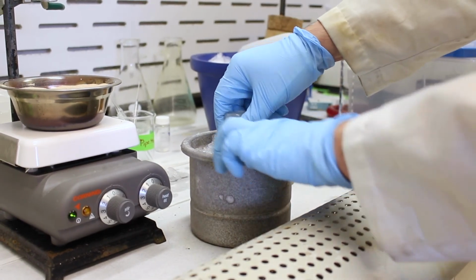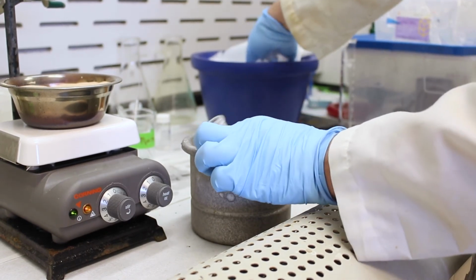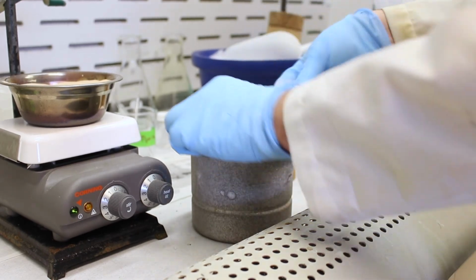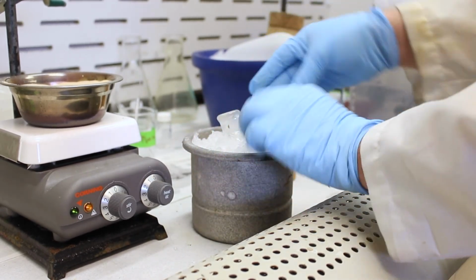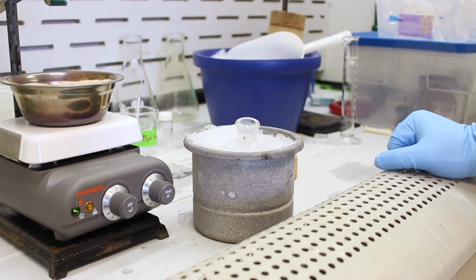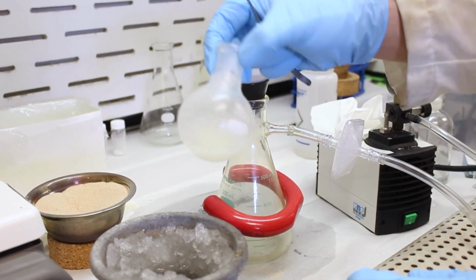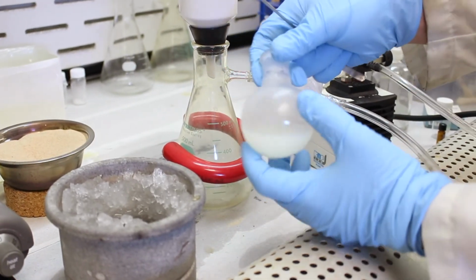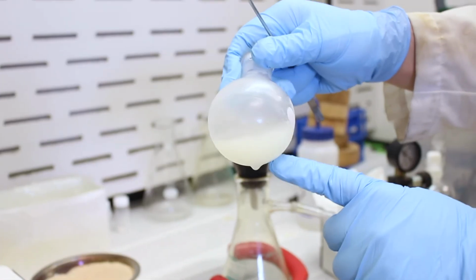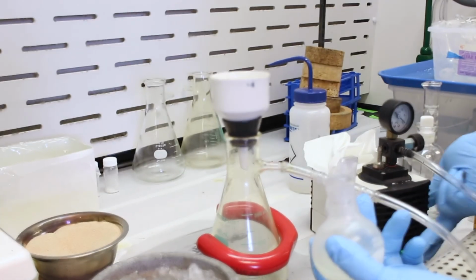Okay, so we've made a little ice bath here, and we'll cover it with a bit more ice. So we're trying to get as much of the product to solidify as possible, just in case any of it is dissolved in the water. Okay, and then we'll leave it to sit on the ice for about 10 or 15 minutes. Alright, so we've got our Diels-Alder product now, and it has cooled in the ice bath for about 10 minutes. So now we're going to collect the solid, so I don't know if you can see it, but there's a little bit of an off-white solid there. And we're going to collect the product by filtration, vacuum filtration.